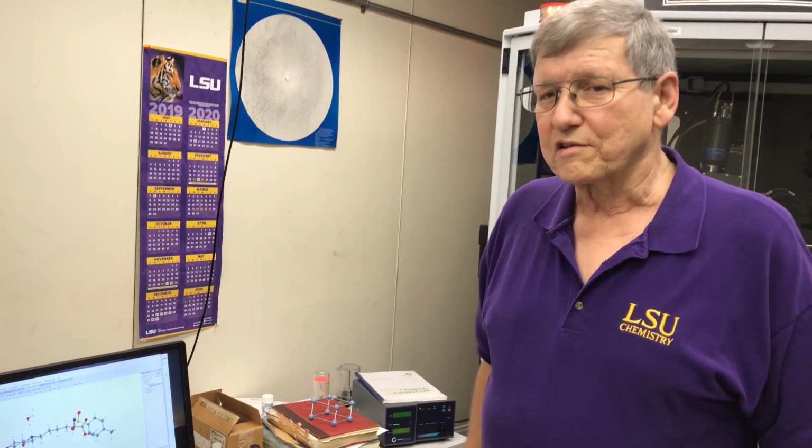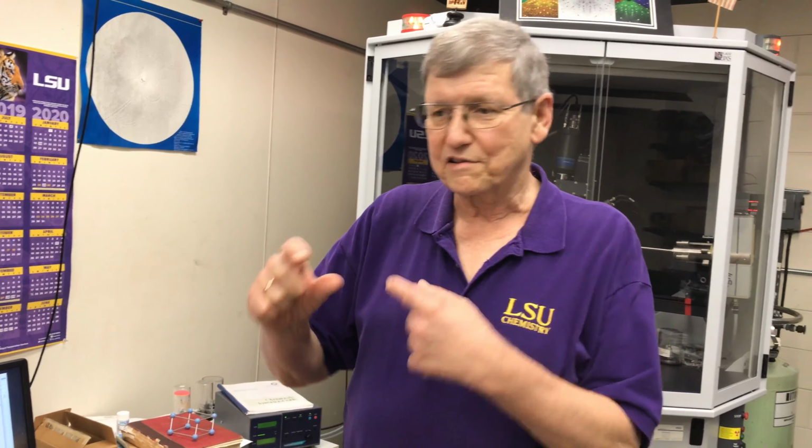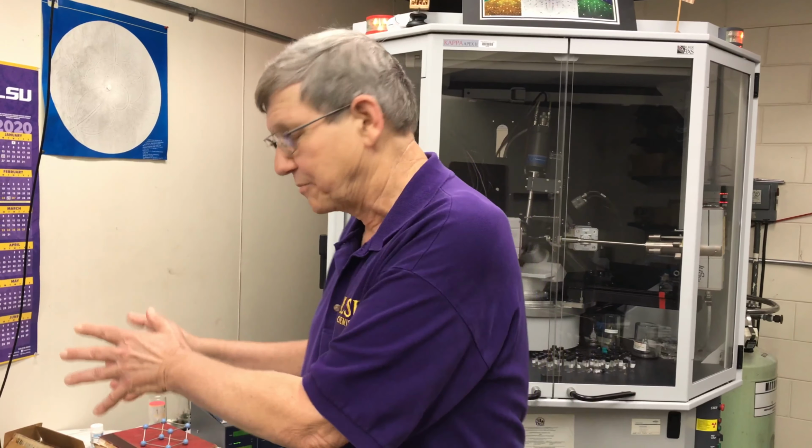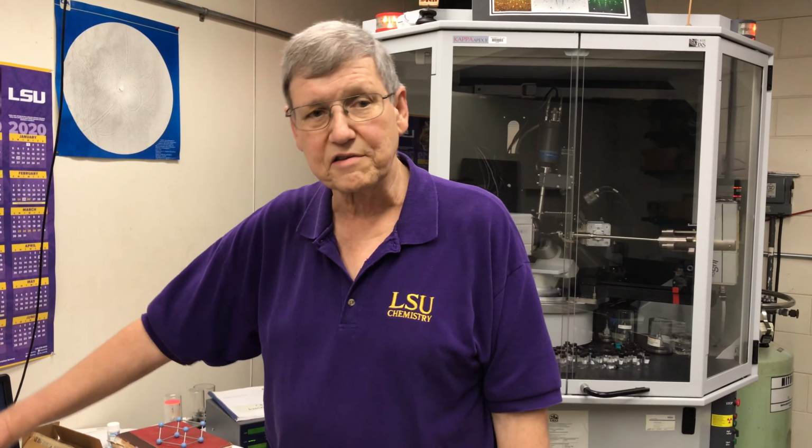The way my laboratory runs is usually graduate students walk in and bring me a little vial that's got some of these crystals in here and just leave it to me to provide all the results. We make no charge for this at the moment. Can't promise that'll always be the case. Or if research directors are okay with that, we can also teach individual graduate students how to do this themselves, or anywhere in between. I can collect the data, give it to the students who know what to do with it. They can do all the calculations, anything in between. So that's what we do.